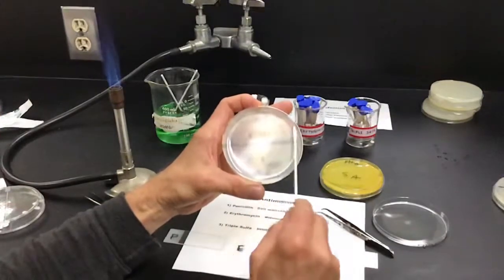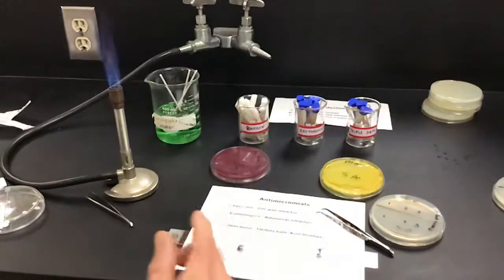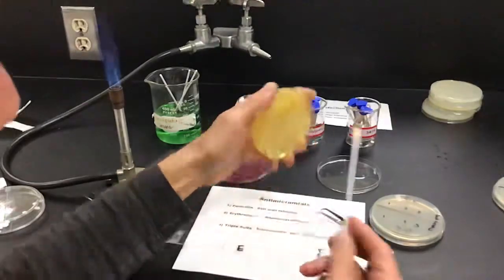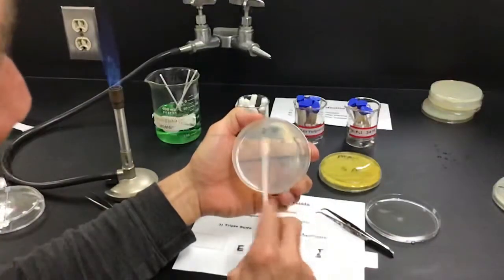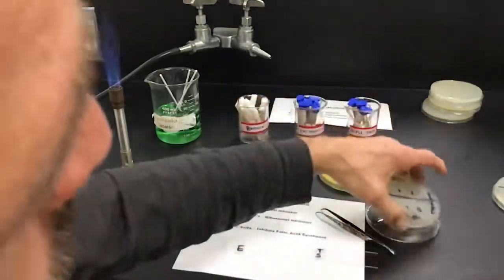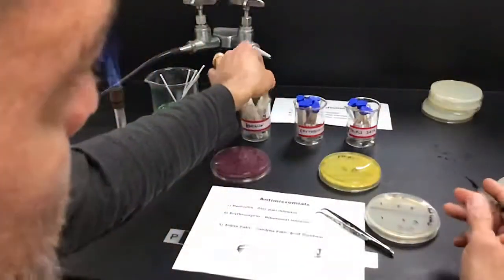All right. So we'll just check 3 antimicrobials again. Once again, penicillin, erythromycin, and triple sulfa. So I'm going to lawn the Staph aureus. It's going to be our gram-positive example. And once again, like I mentioned with the disinfectants, the gram-negative should be slightly more difficult to kill. It has those 2 cell walls.